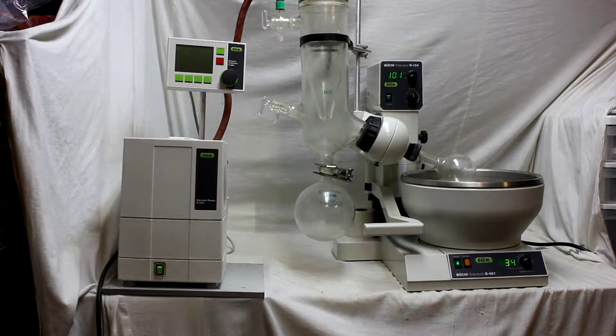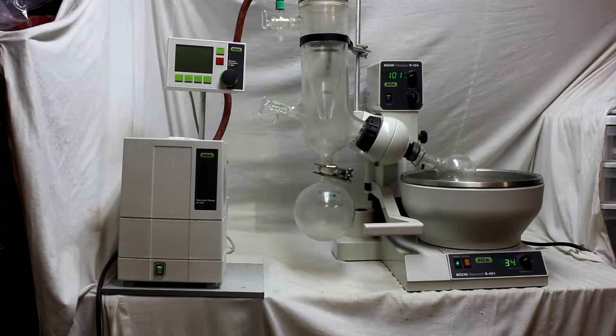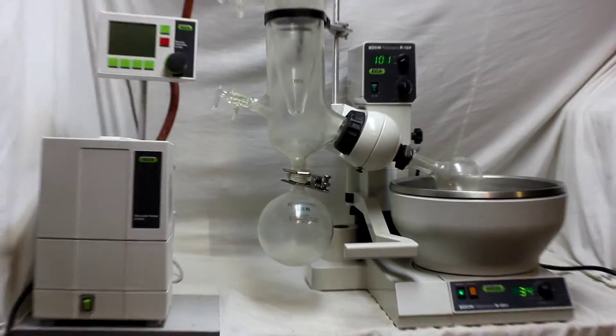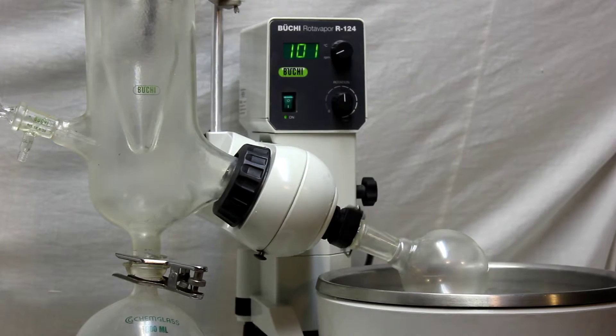Rotavap performs under vacuum. At first we just want to see how gently it's working without any noise, and I'm gonna go increase the speed.